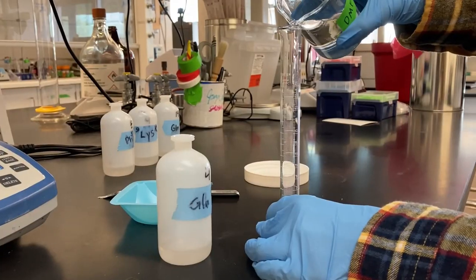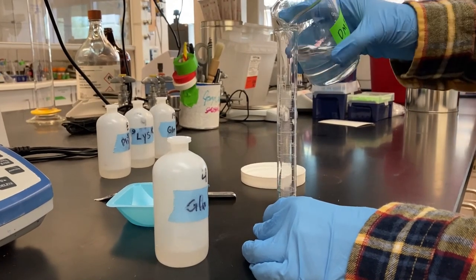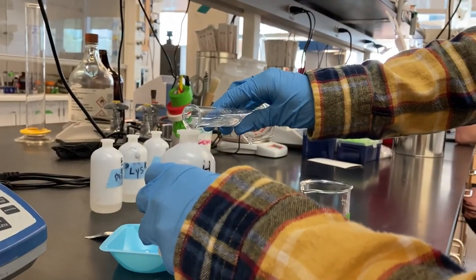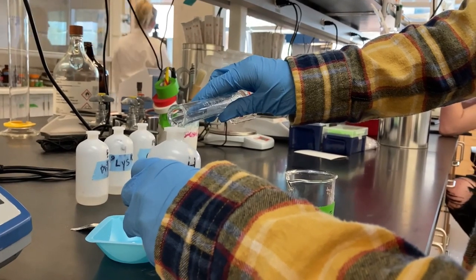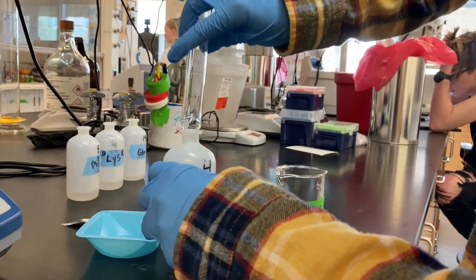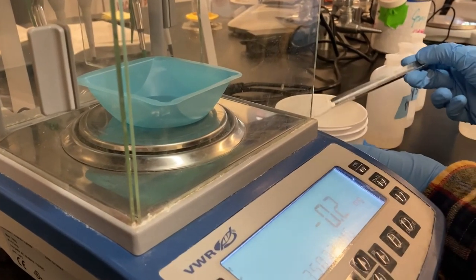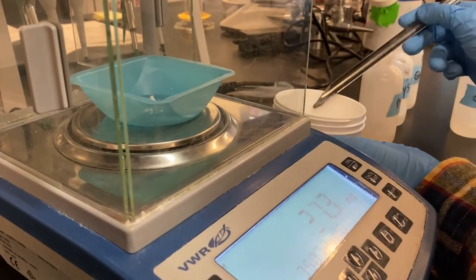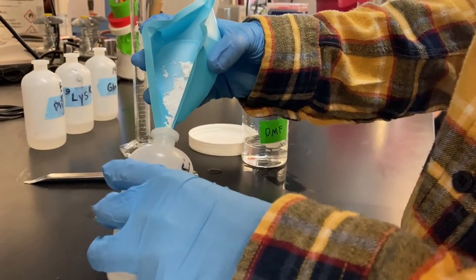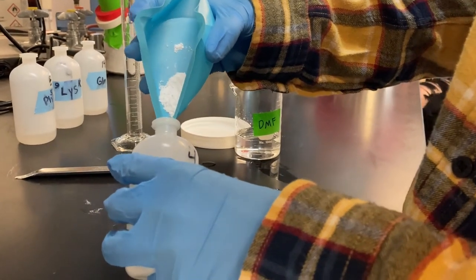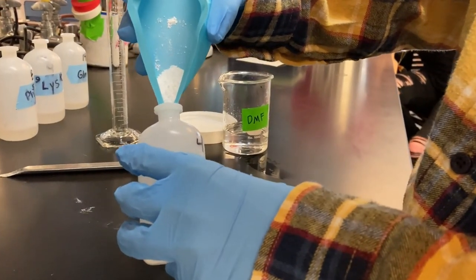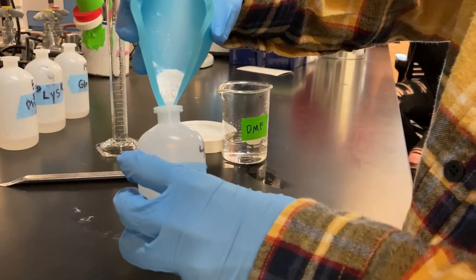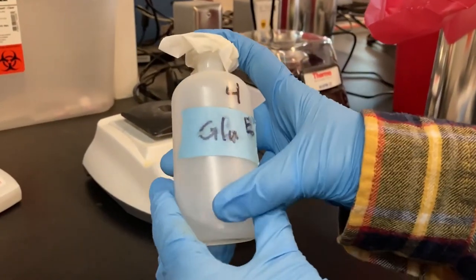When preparing the amino acids, make sure that the amino acids are completely dissolved in DMF. Vortexing the solution for several seconds can help.